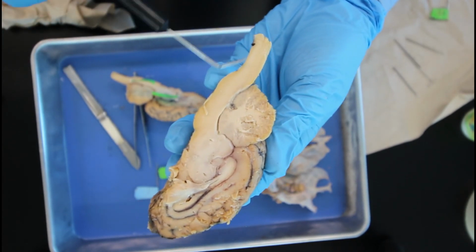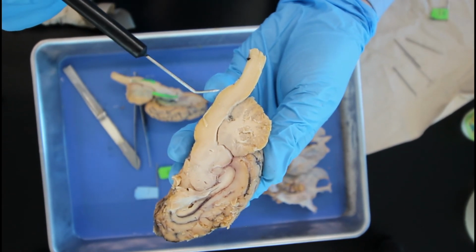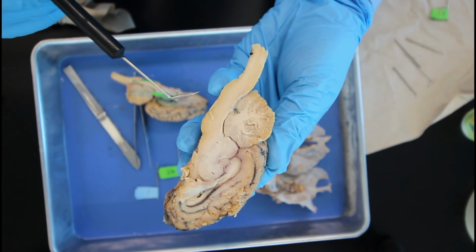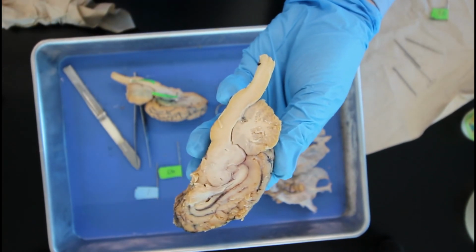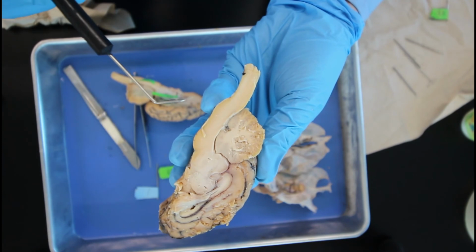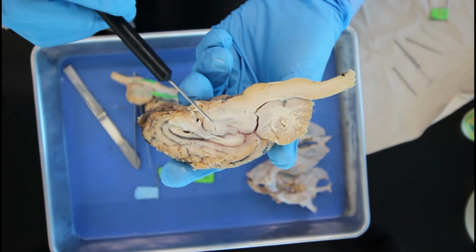All right, the brainstem region connects the spinal cord to the cerebrum, and this consists of the three major areas that we had pointed out before. The medulla oblongata, this part is responsible for ascending and descending nerve tracts, and also as the center for several important reflexes such as heart rate, breathing, swallowing, and vomiting. Coming up over to the pons region, this little bulge part.